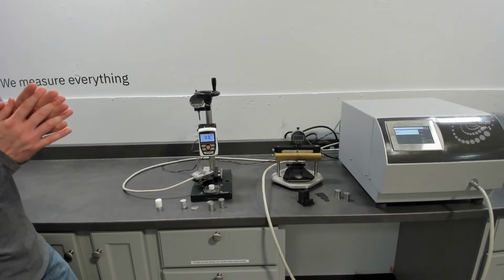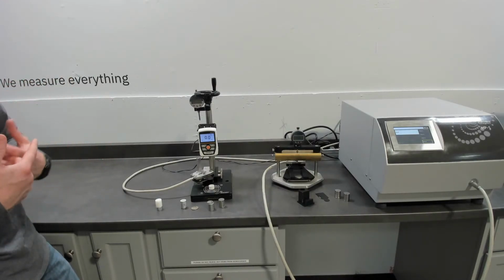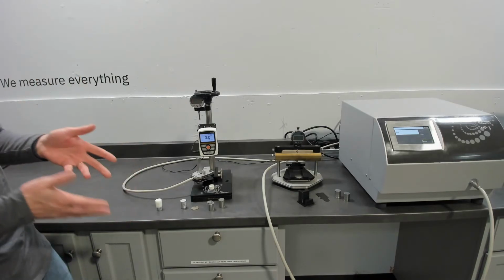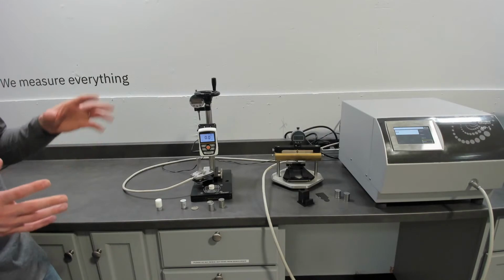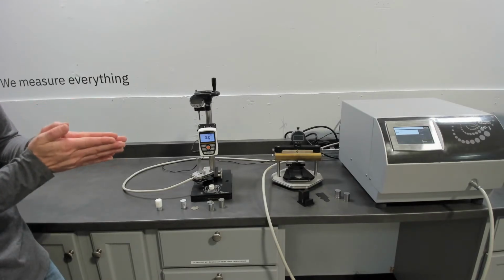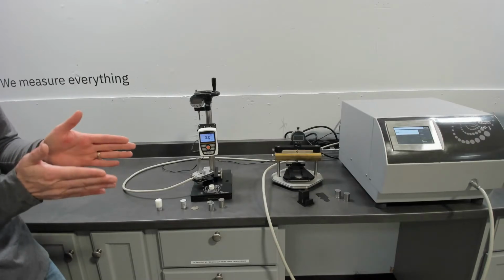So that's a rather significant potential area of importance, depending on the variables that you're trying to achieve. We hear a lot of customers describe that. So this is an important capability for those types of applications, to understand how the materials react together and the contact resistance between them, so that data can be transferred through to simulations, so the simulations can be more accurate.